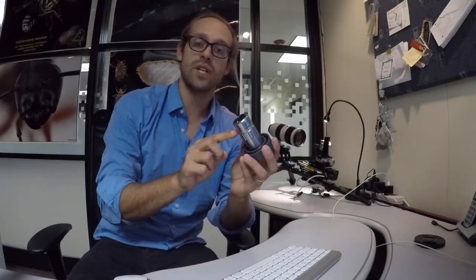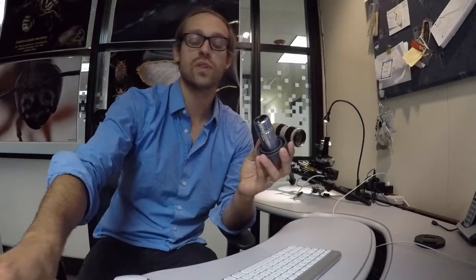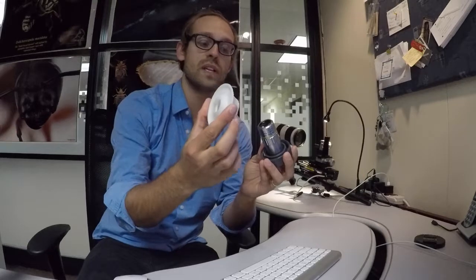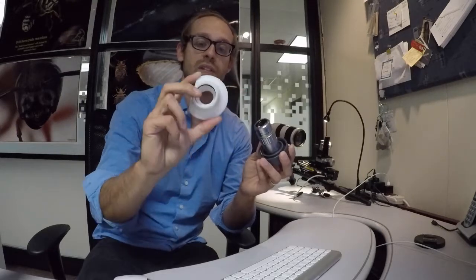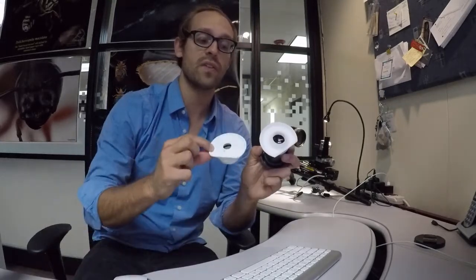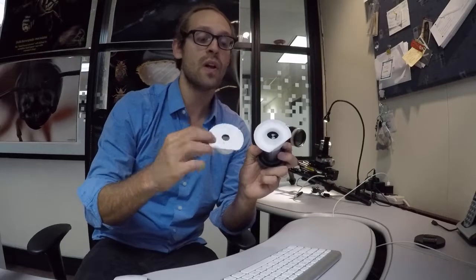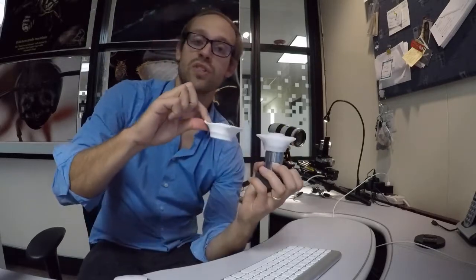But for the 10x objective, it's very important to use the correct diffuser. The 10x objective has a diffuser that gets situated directly on the front. It's got the o-ring in the back and just allows you to snugly place it directly on the front of the lens. And this differs from the other 50x and 100x diffuser because the bellow is much deeper.